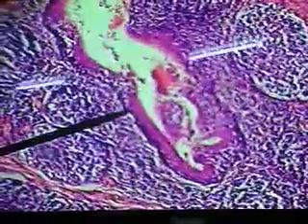Okay, so these are the tonsillar crypts. So this would be one example of one of the tonsillar crypts that we're seeing right here. Okay, so there are the many lymph nodules that we're seeing right here, also associated with stratified squamous epithelium. The hemicapsule is going right around it here. Let's trace it down here. That's the partial capsule that's surrounding it, sending a few trabeculae in right here, as you can see. So that's another example of the palatine tonsil.